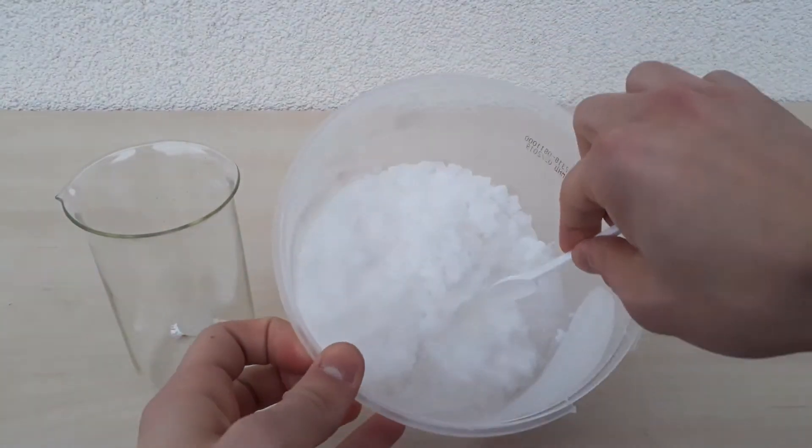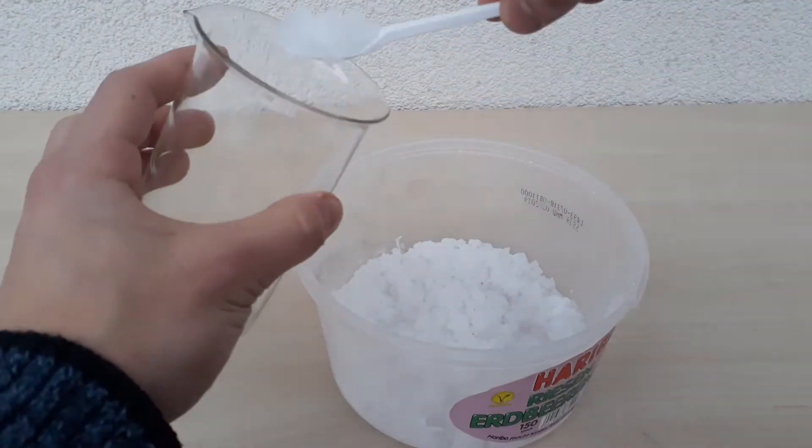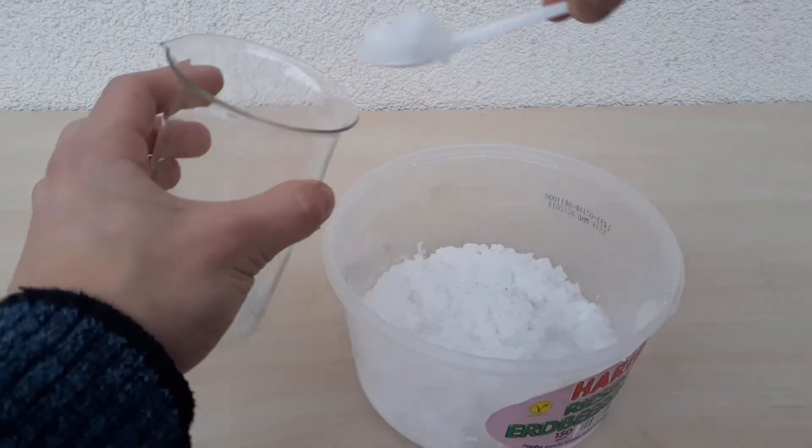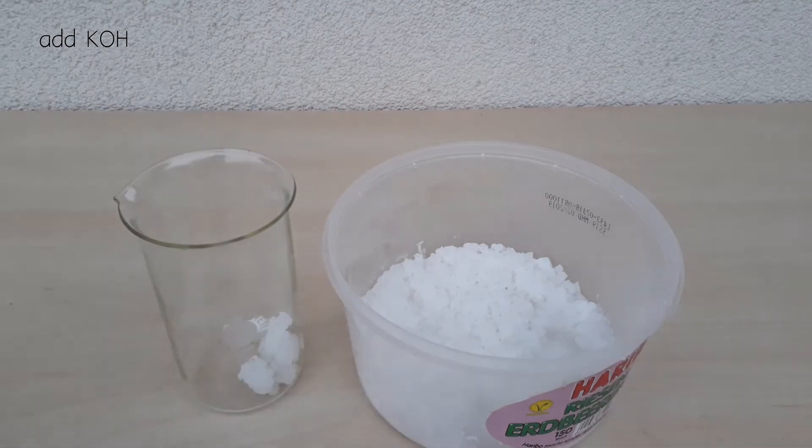This is not so bad though, because for this prep I am actually not even going to measure out any precise amounts of anything. I just add a couple of spoonfuls of potassium hydroxide.